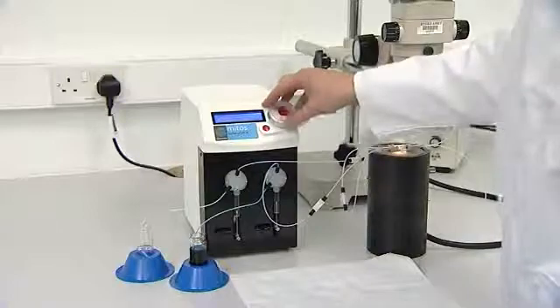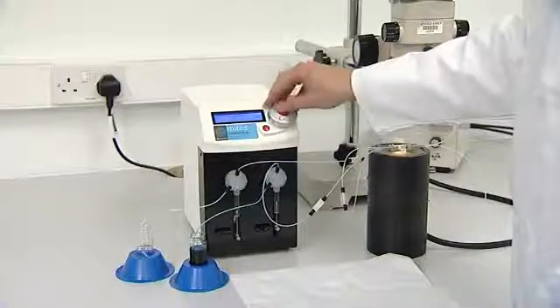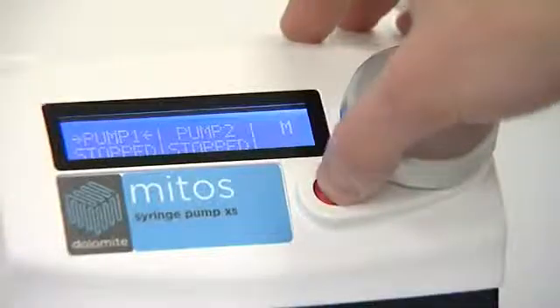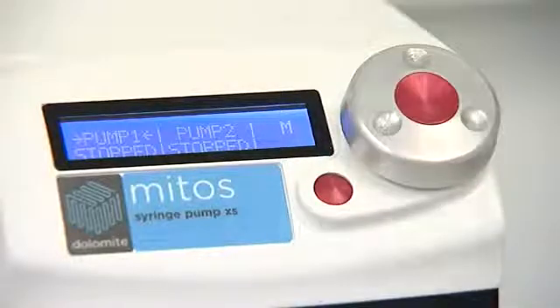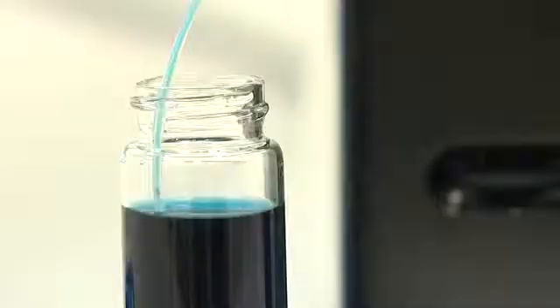Now that the fluidic system is complete, the pump is switched on either from the front panel or controlled by a PC. Fluid is pumped at the desired rate.